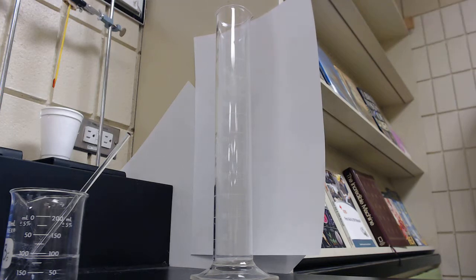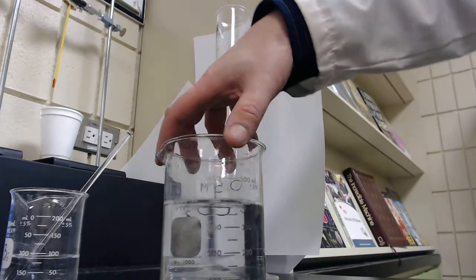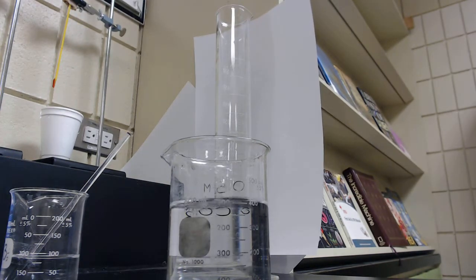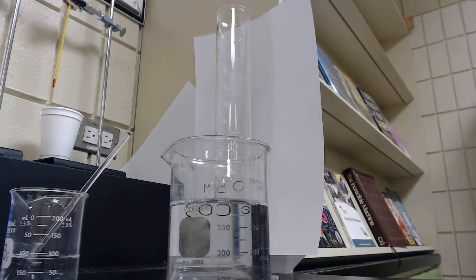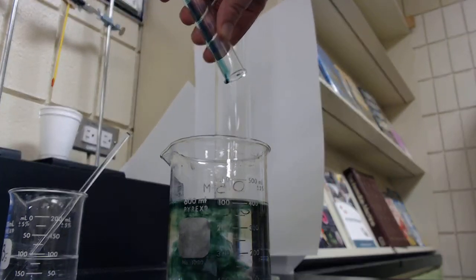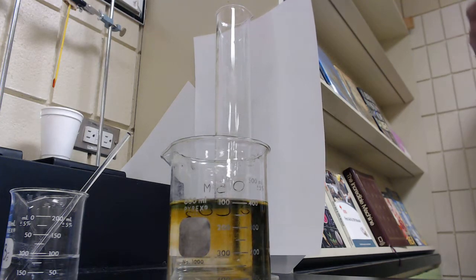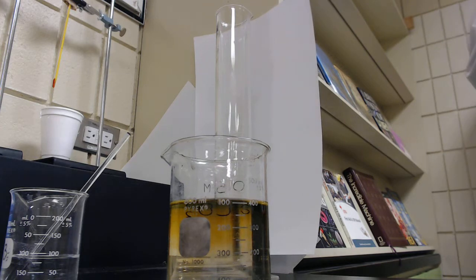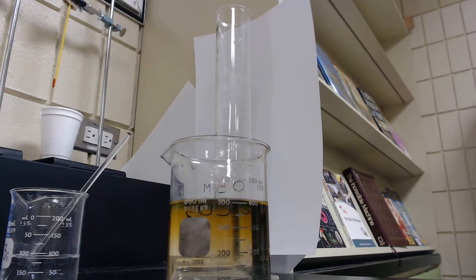We're going to measure 350 milliliters of water into a 600 milliliter beaker — I've already done that. Now I'm going to measure three to five mils of universal indicator. For your introduction you should look up what it is and what it does — it's an acid-base indicator with colors for the entire pH range from 1 through 14. I add the indicator and you can see it's going nice green with some yellow, which is what we should see from a universal indicator in water — the middle colors of ROYGBIV are neutral.